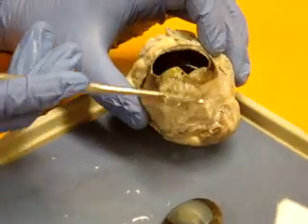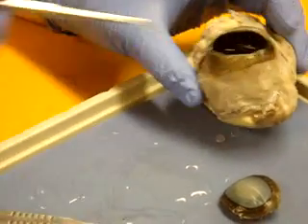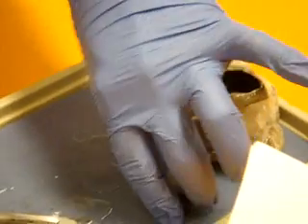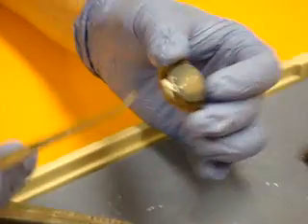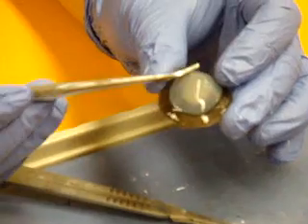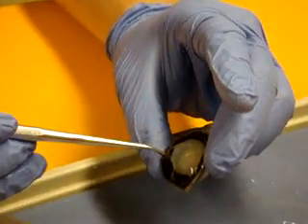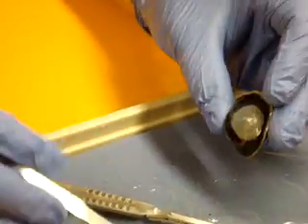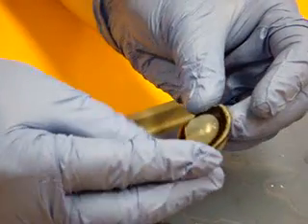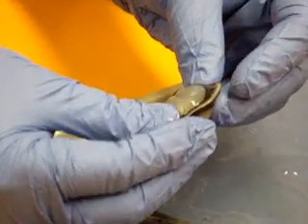So that is all the stuff of the posterior cavity of the eye. Now we're going to move on to the anterior cavity. Here's the sclera continuing to the cornea, and then the choroid continues to this structure right here that's holding the lens in place — that's your ciliary body. If I start pulling out the lens, the lens is attached to the ciliary body by little ligaments called suspensory ligaments.